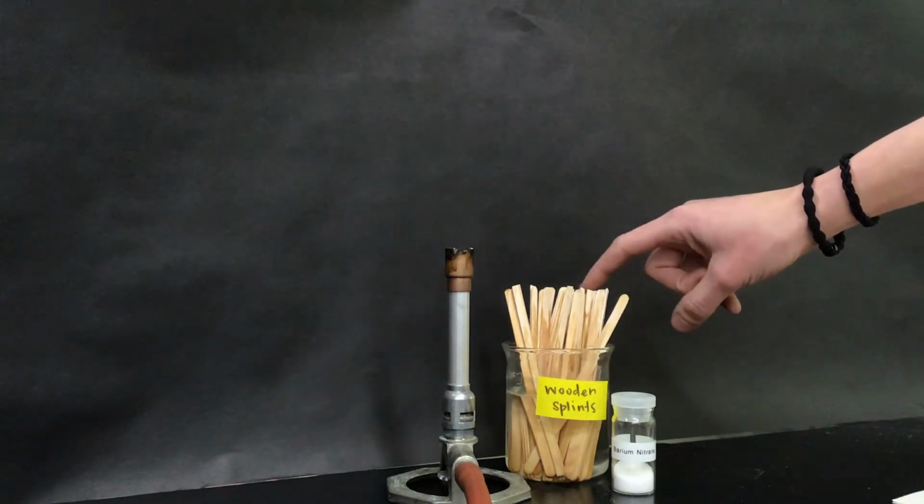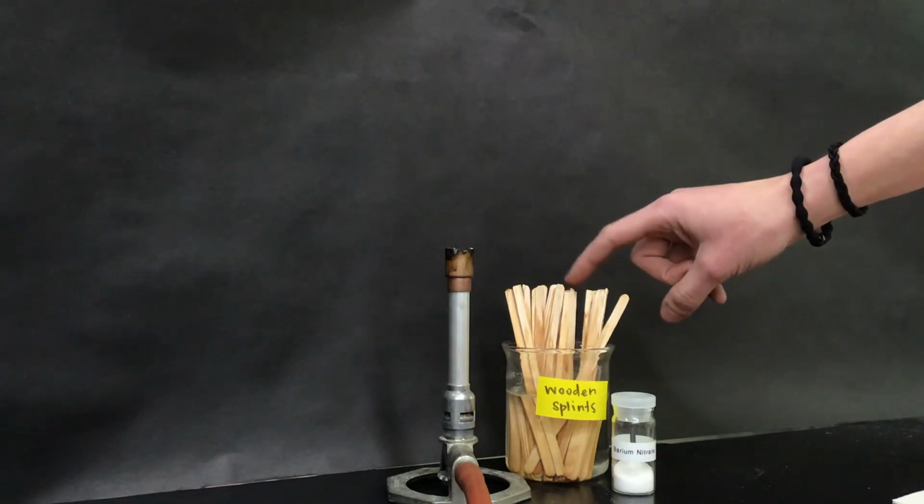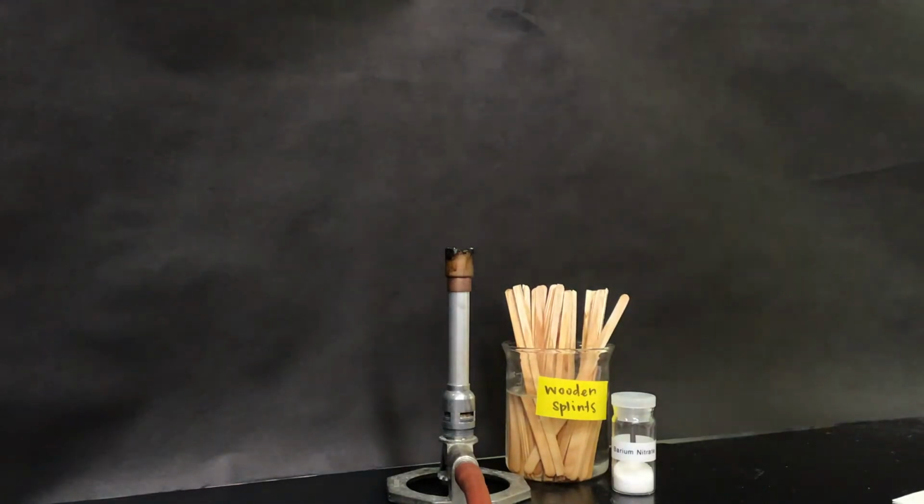The soaking is really important because we're going to be holding them into the flame, and we want to see the color that our chemicals are turning the flame. We don't want to see the wood burning, so that's why they're soaking. And the fact that they're in DI water, that's deionized water, is pretty important also. I want you to keep that in the back of your head, and at the end of this lab, you're going to tell me why it's important that we use DI water to soak them as opposed to, say, tap water.